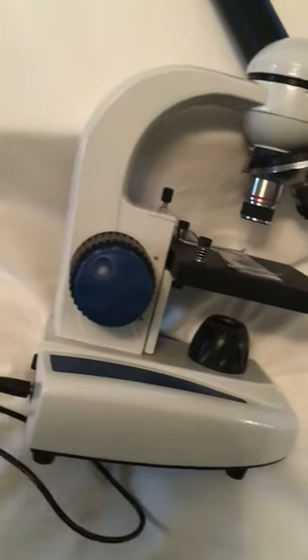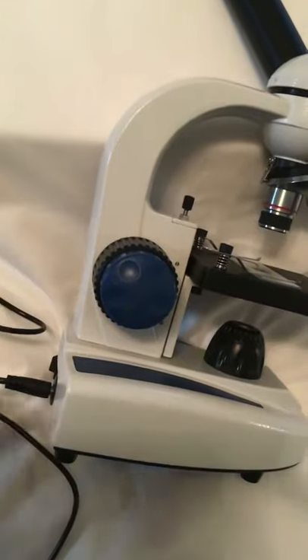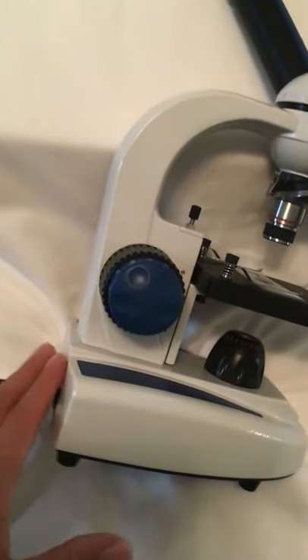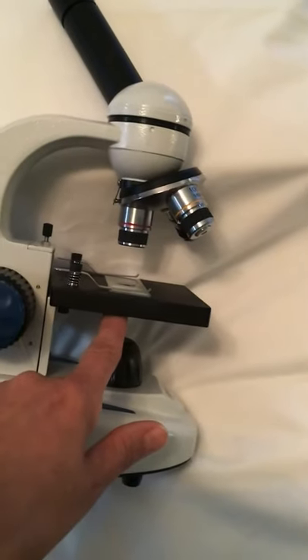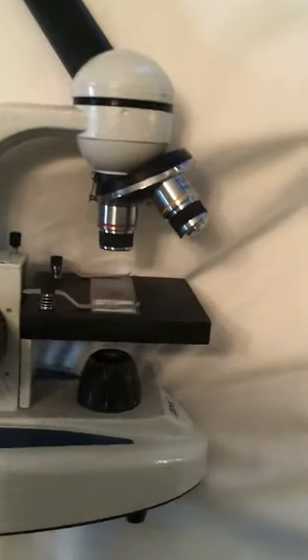My microscope is not plugged in at this time, so I'm trying to do this in a different location. But you turn on the power switch, and then this lamp would project light through that opening in the center of the stage.